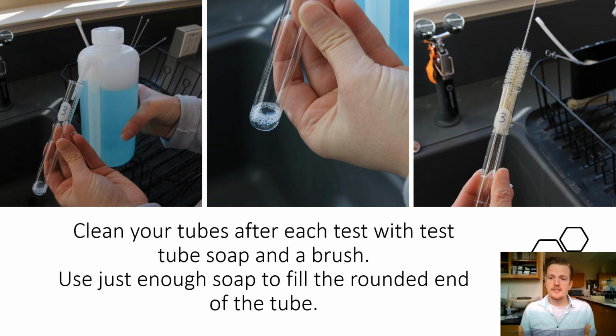This is actually a more important step than it sounds. You need to clean your tubes, ideally before and after you use them, because other people are going to be using the same glassware that you will be using, and if there's any contamination left in their experiment, then you need to get it out, and you want to be courteous and make sure that you're not leaving contamination in the test tube for future. So if you can imagine that you have an energy drink in a test tube and there's milk residue in the bottom, whatever the milk has in it is now in your test, and it's going to invalidate the results of your test. So cleaning is just as important as organizing when it comes to lab work.